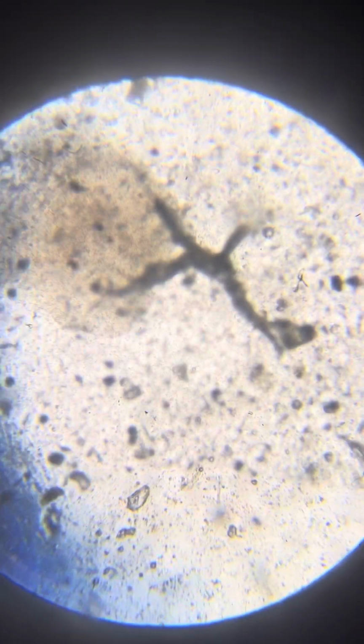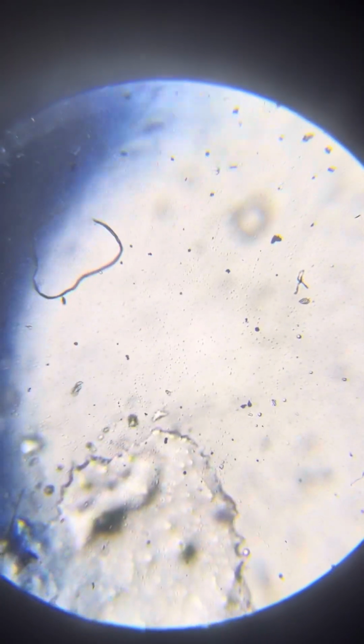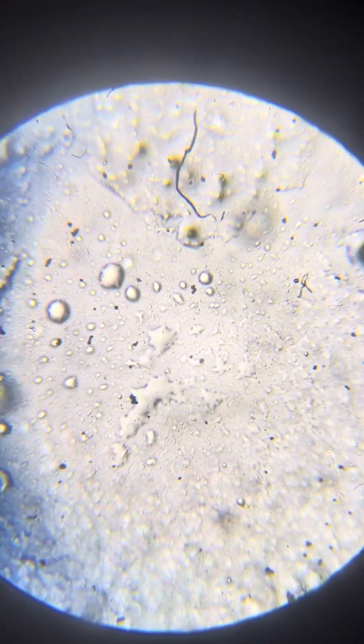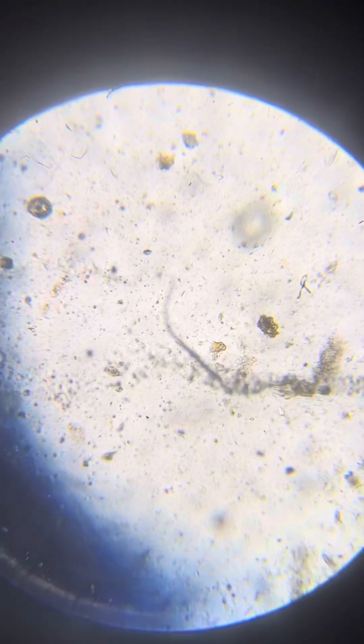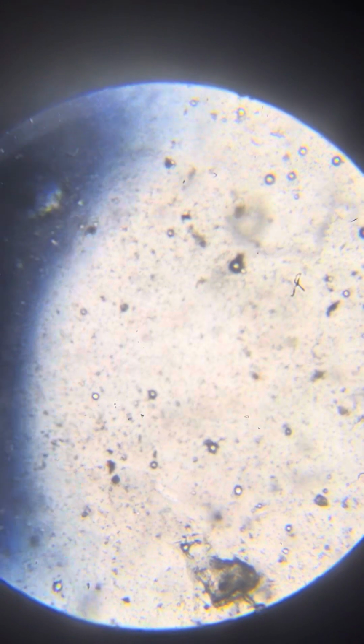Another one. What is this? This is frightening. I don't know what it is, but it's certainly a life form and certainly a frightening one. Okay, more life forms, more bubbles. Bubbles and neros and life forms.